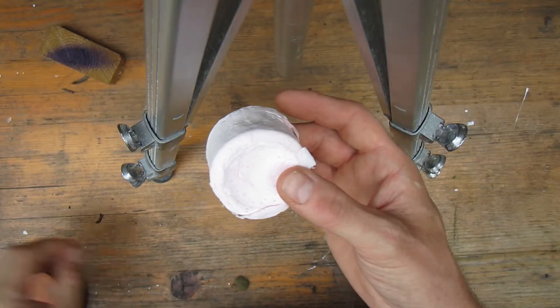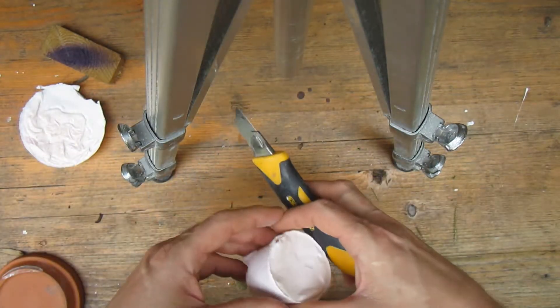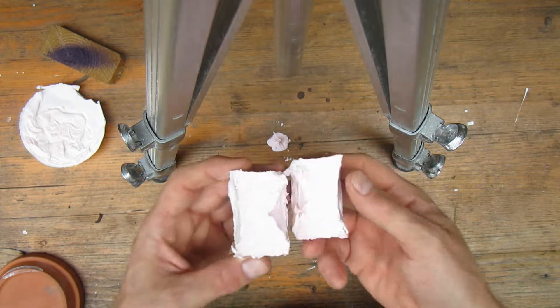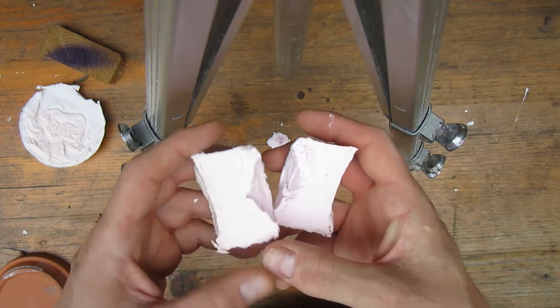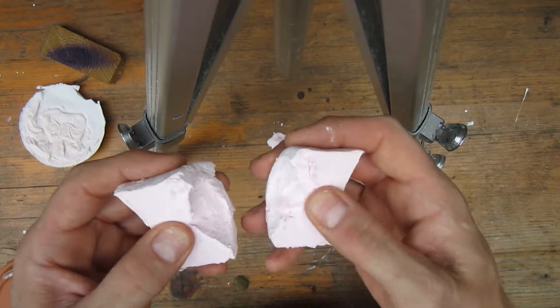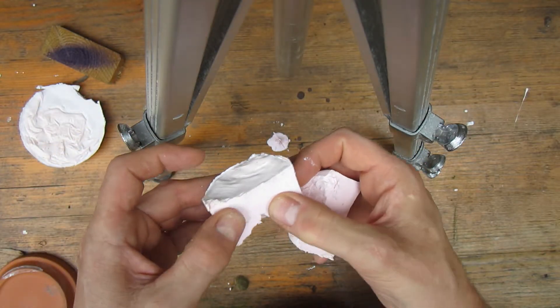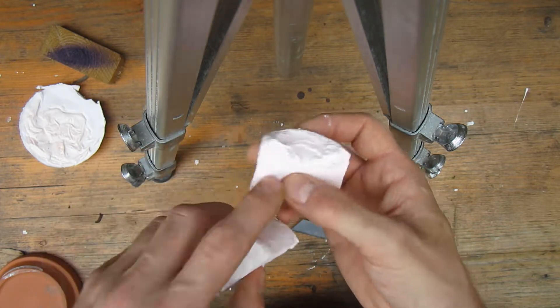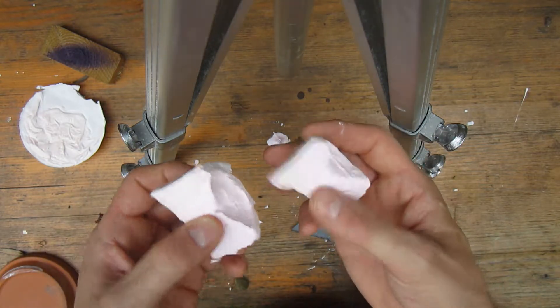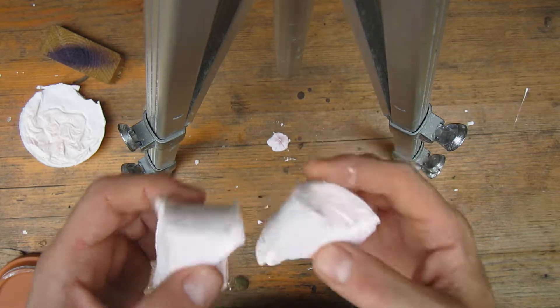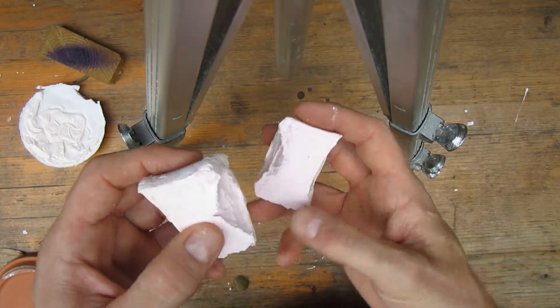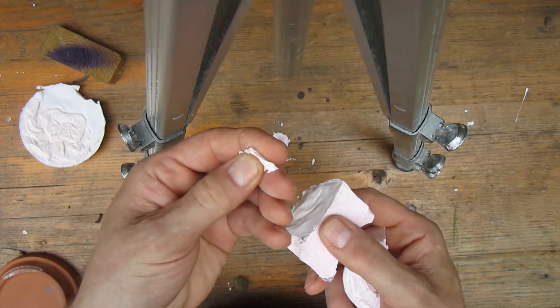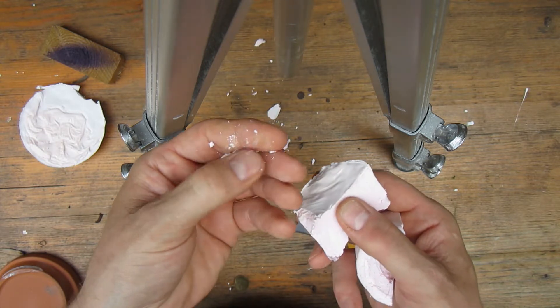Let's wrap this up, let's cut into this stuff and have a peek. You know what this reminds me of is the extruded polystyrene, the stuff you buy to insulate your house. It's very similar, about the same weight. This probably doesn't have a hell of a lot of uses but it is kind of interesting. I think what's happening here: you're not reforming the same plastic that you had before after you've dissolved, it's not re-polymerizing, but you probably have all these little bits and pieces that simply stick together. You can tell that this is like almost powdery at this point.